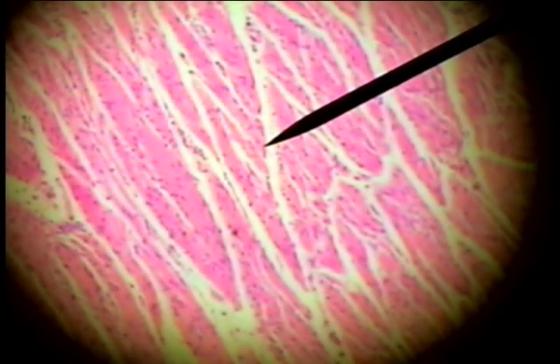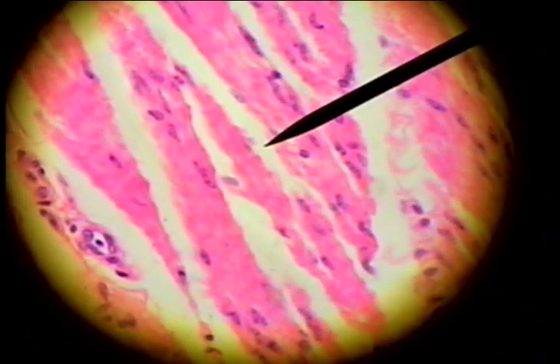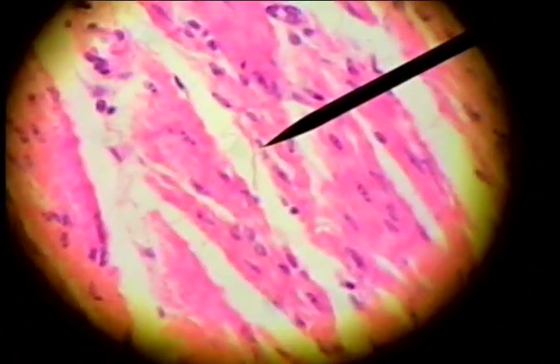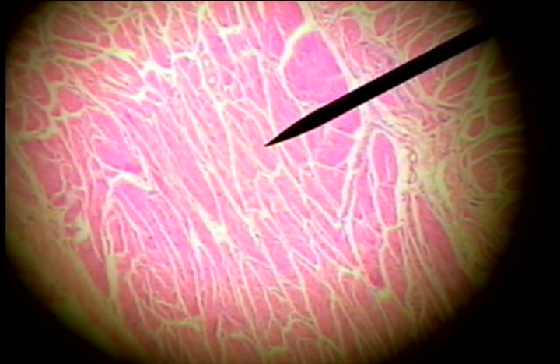We'll go down on higher power and look at this muscle layer. This is smooth muscle, it's not skeletal. And so this would be smooth muscle of the muscularis externa.